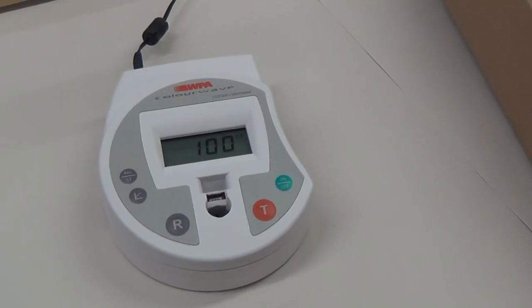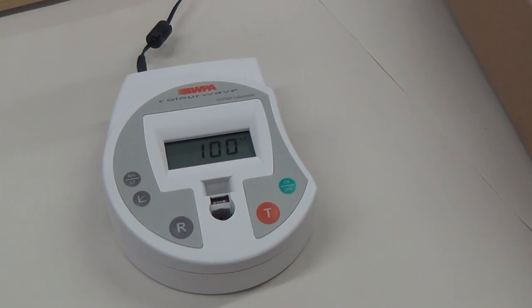Hi everybody. We've got a colorimeter here. It's the CO7500 colorimeter by WPA, and it's very easy to use. I'm just going to show you how we can use it.